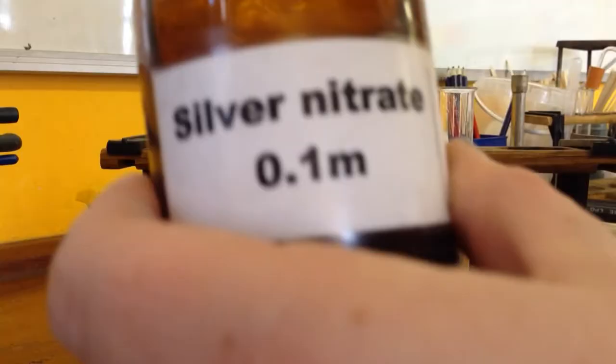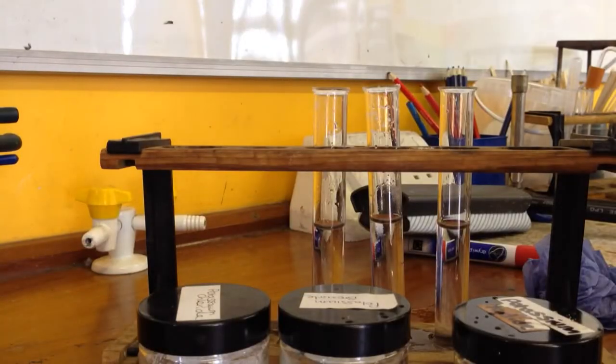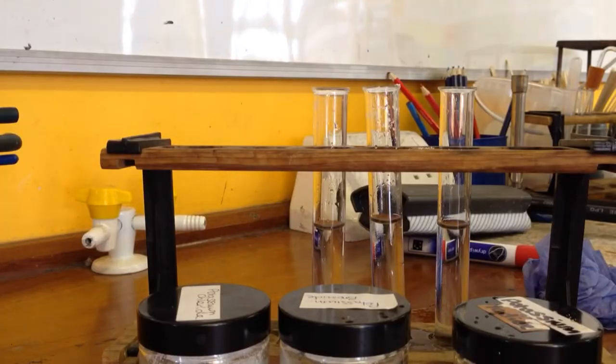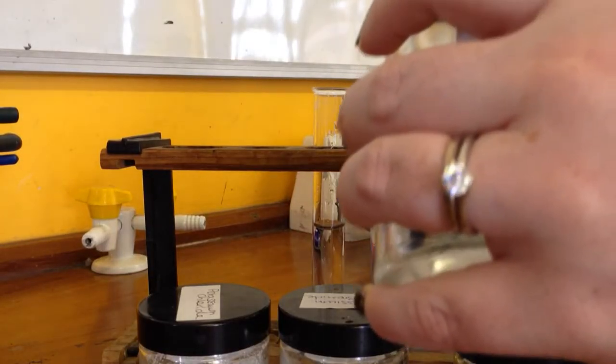So you need some nitric acid and some silver nitrate. You need to add two drops of nitric acid to each solution and then mix.